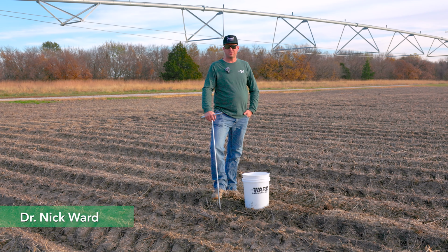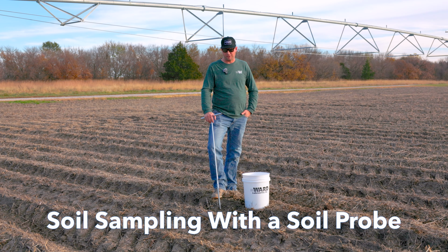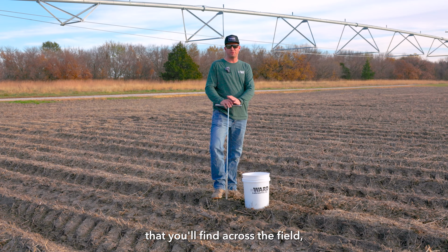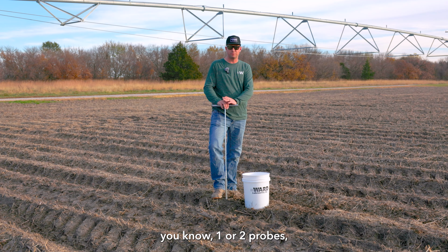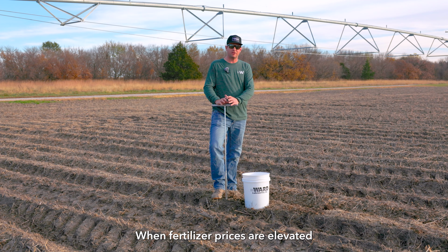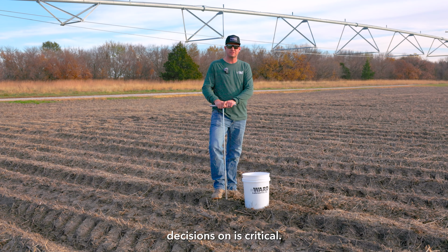Okay, in today's video, we're going to talk a little bit about soil sampling with a soil probe. Kind of the most critical thing is to ensure that you take enough samples to encompass the variability that you'll find across the field. You know, one or two probes, although easy, is not really going to tell the whole story. When fertilizer prices are elevated and grains low and we got tight margins, having good soil test data to base decisions on is critical.